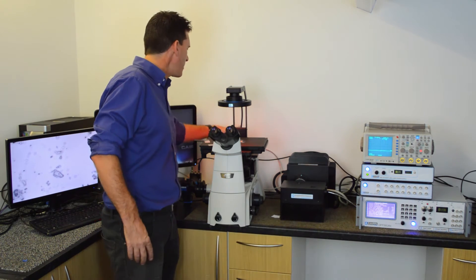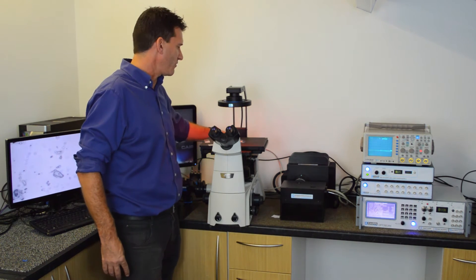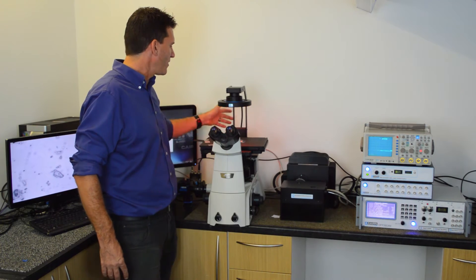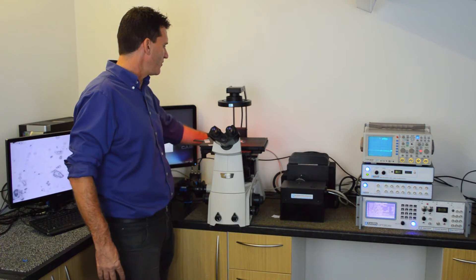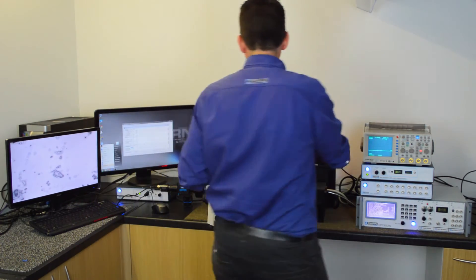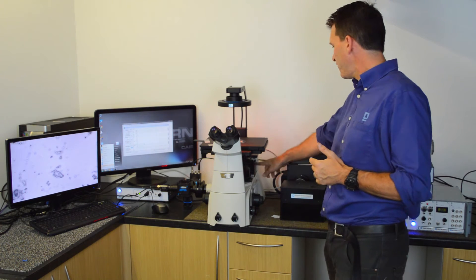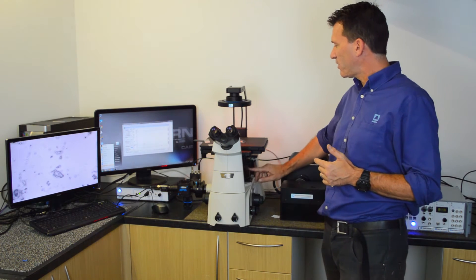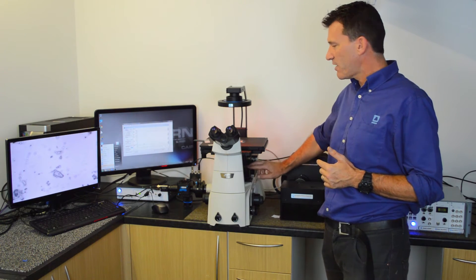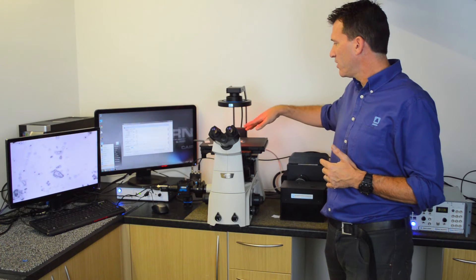The photons from the OptoScan are fed into the back of a research microscope — in this case an inverted microscope, the Nikon Ti. The photons are focused onto the back of the objective and reflected up by a dichroic mirror. The short wavelength of light passes to the sample.